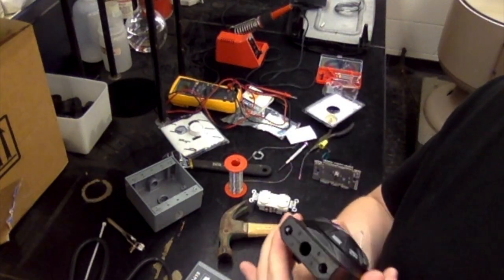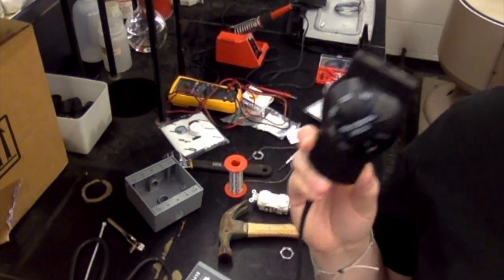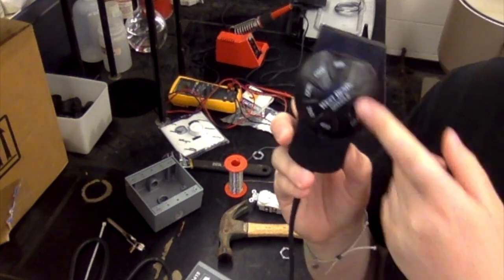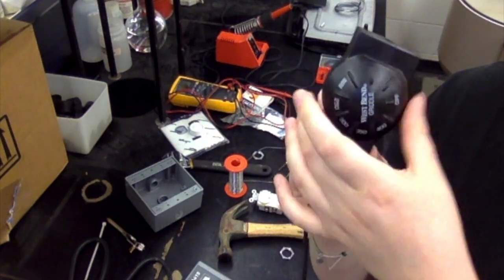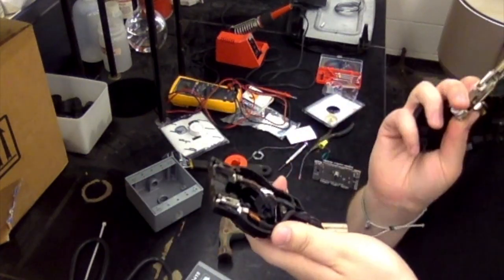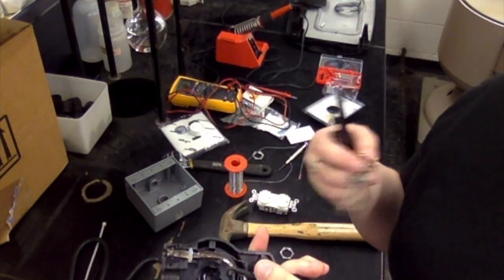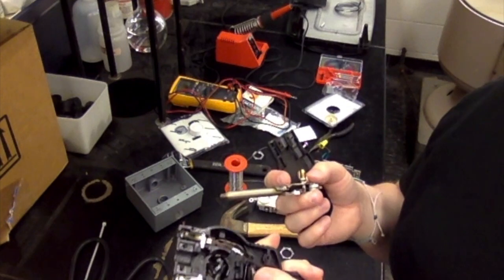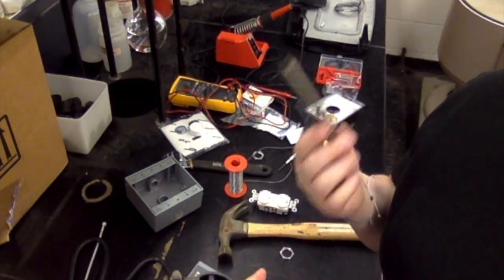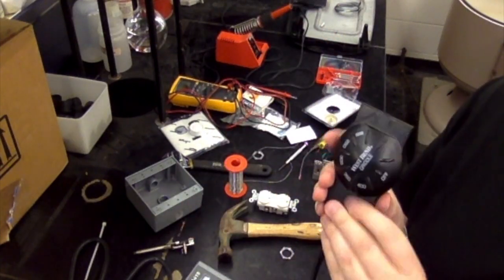Another note too is if you're not using the West Bend model, you could run into some issues, and this is the start of where you're going to start running into issues. Some companies fasten the dial onto the thermocouple, that part that we took out, and so it's not going to come out very easily. We have some griddles here in the lab that had that type of design, and what we did was we just broke it off. So that's an option. But again, if you're using the West Bend, it's pretty straightforward and pretty easy.